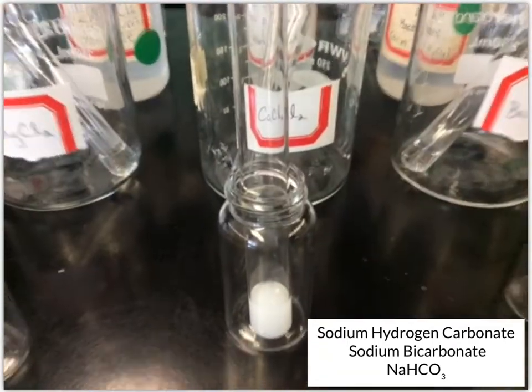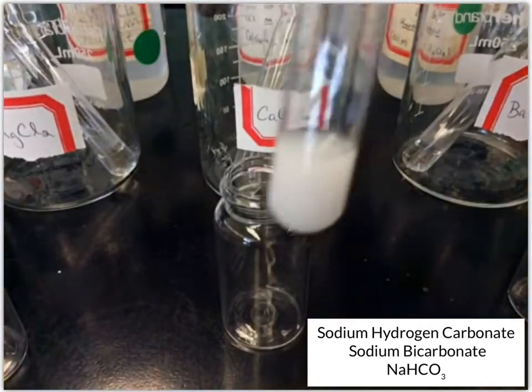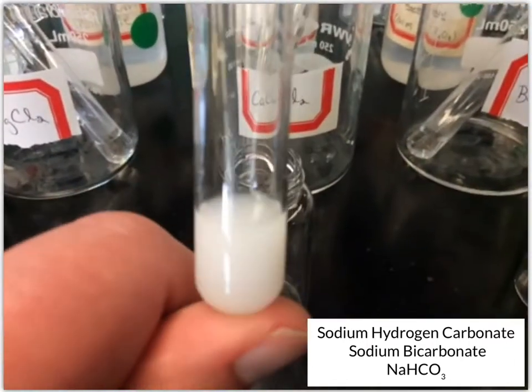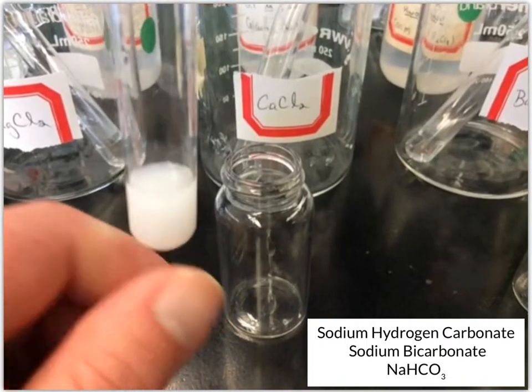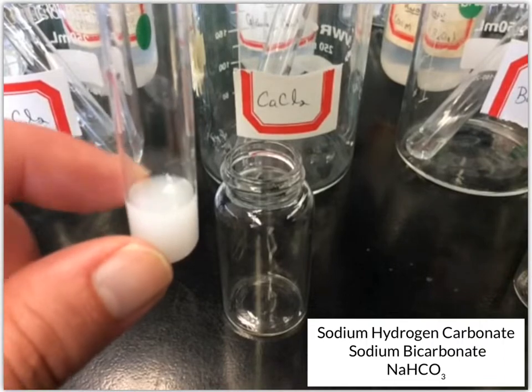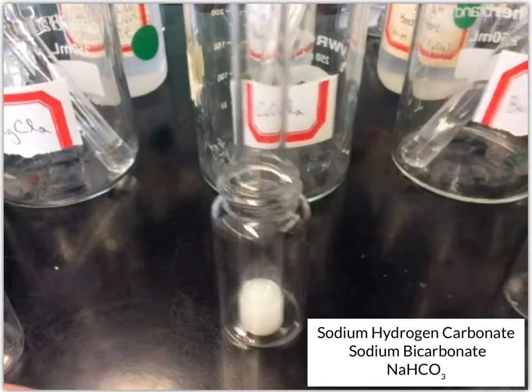So we've got the calcium chloride, which formed this kind of white solution. It hasn't settled yet, but if you look around the top up there, you can kind of see that it's grainy. You've definitely got some white precipitate in there.